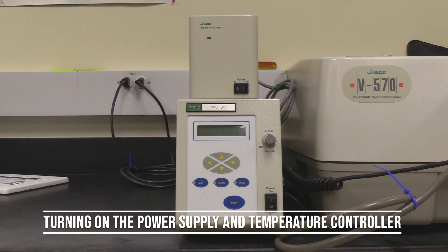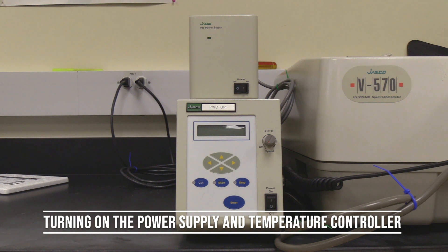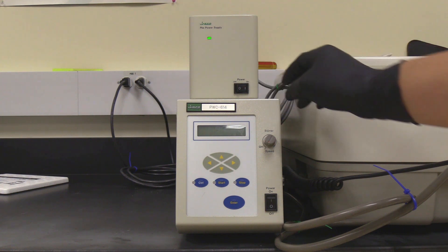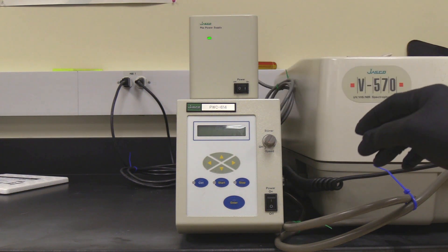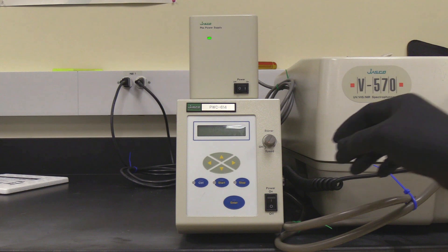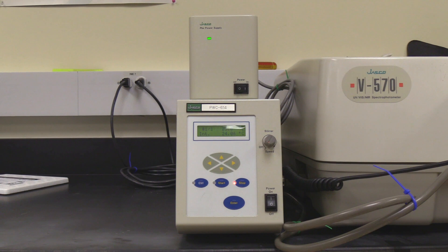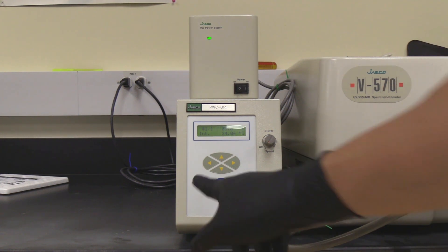Turning on the power supply and temperature controller. Flip the power switch on the bottom right corner of the power supply. The green indicator light should turn on. If temperature control is needed, the operator will need to turn on the temperature controller. Flip the power switch on the bottom right corner of the temperature controller, then press the start button. The indicator light should turn on.